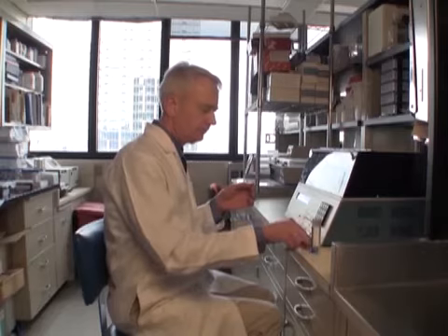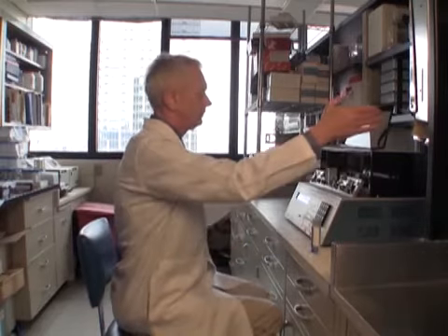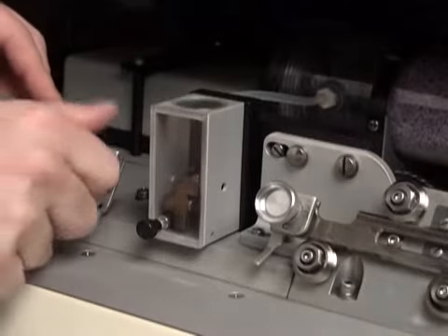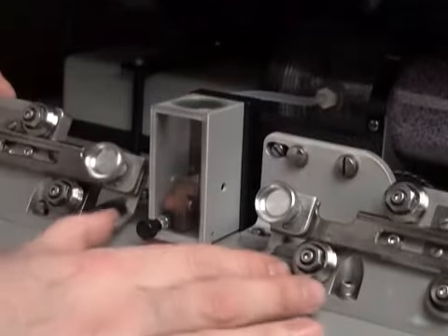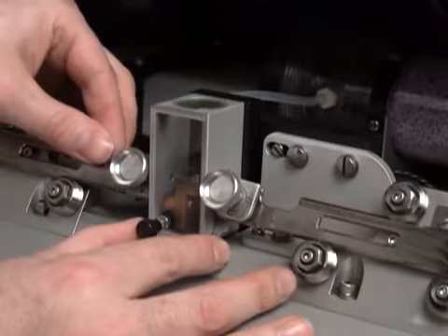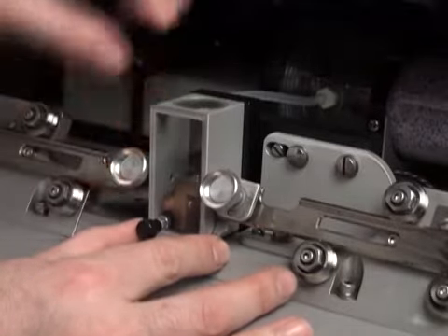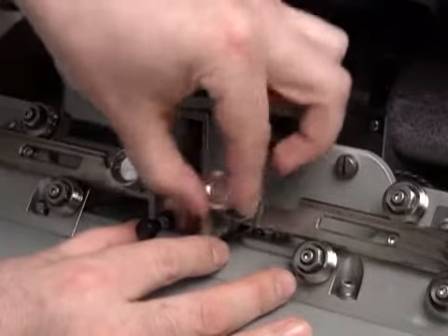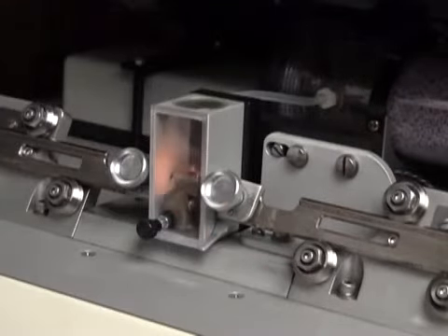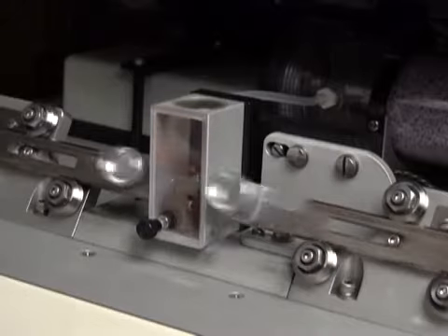To prepare sharp electrodes for intracellular recording and dye injection, pull capillary tubing with a microelectrode puller. We use thin-walled, filamented borosilicate glass with an outer diameter of 1 mm. The recording electrodes should have a resistance of about 10 megohm when filled with 3 molar potassium acetate, and so we adjust the puller accordingly.